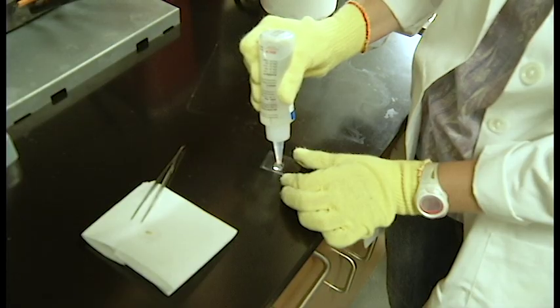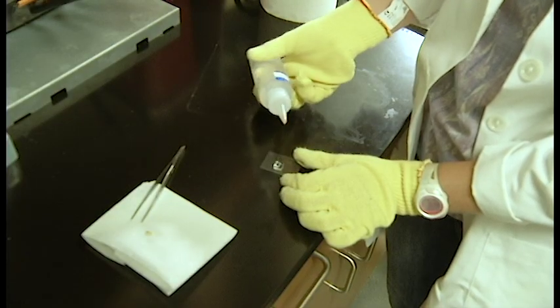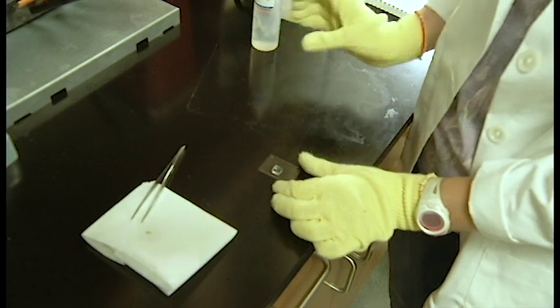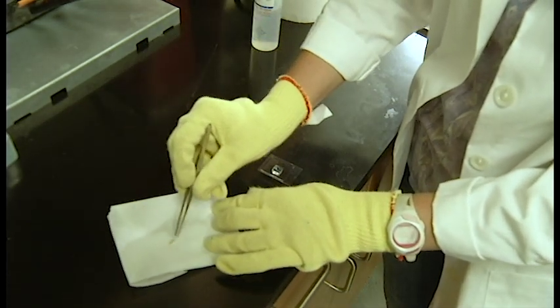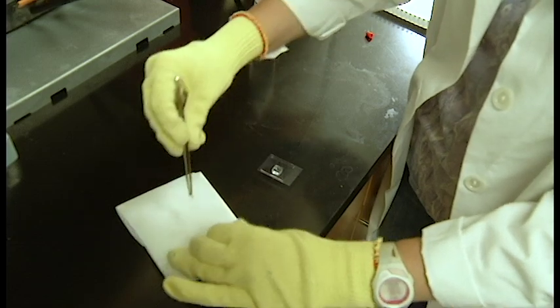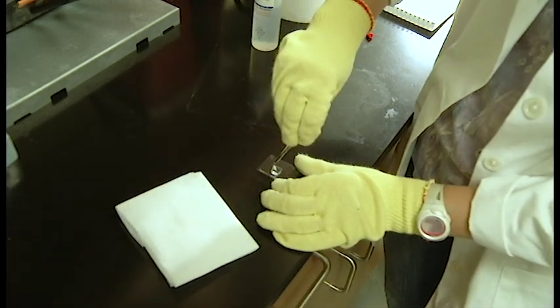To make this kind of block, simply place media in the center of the mold, grab your tissue using tweezers, and place it in the center of the mold oriented upright. You're going to need to use the tweezers to help it stand upright because the tissue will try to fall over.